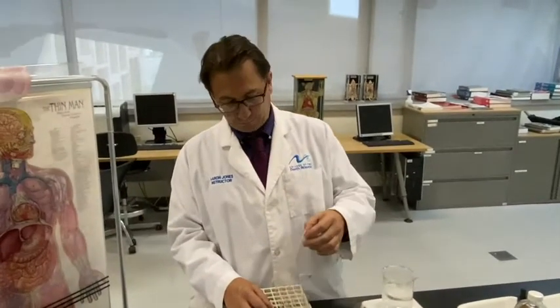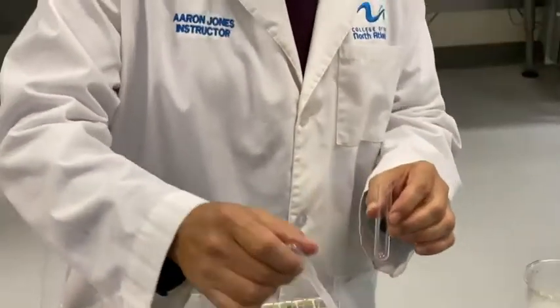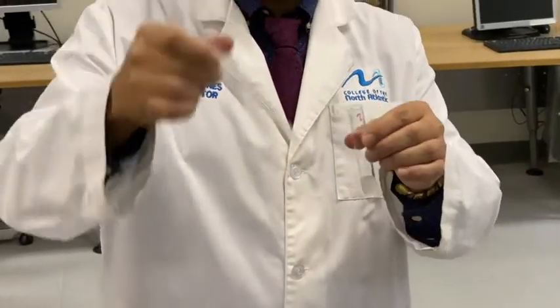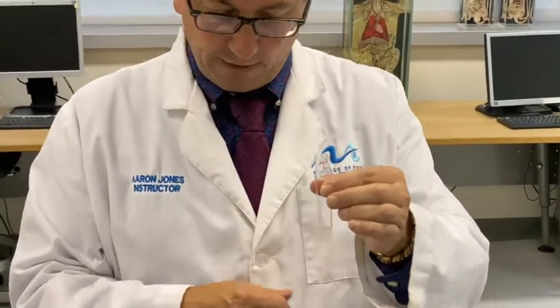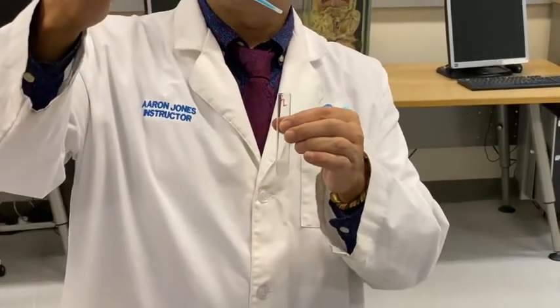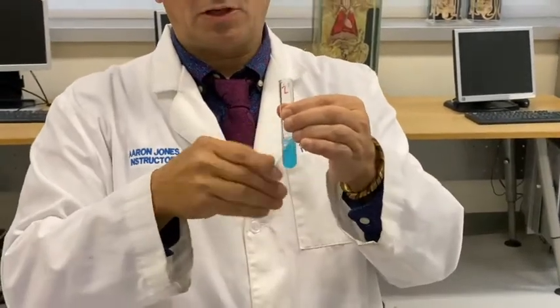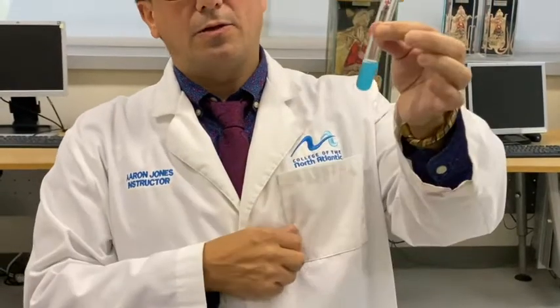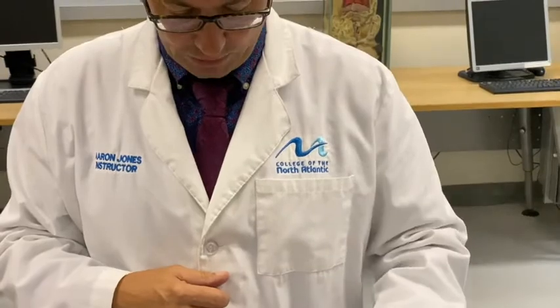We got test tube 2 now, and that calls for 5 milliliters of starch solution. Again, a cloudy solution. We're going to add 5 mils of Benedict solution. Benedict solution is a light blue color. When added to the starch solution, there's no change. It requires heat in order for us to get an indicator. We're going to heat that in the hot water bath now for 2 minutes, 3 minutes.